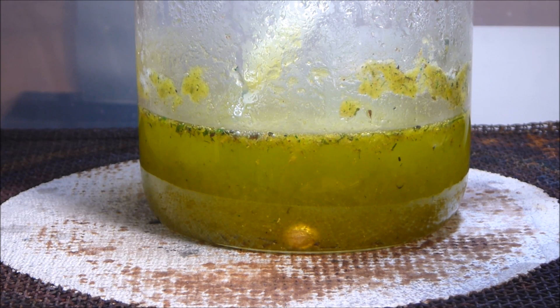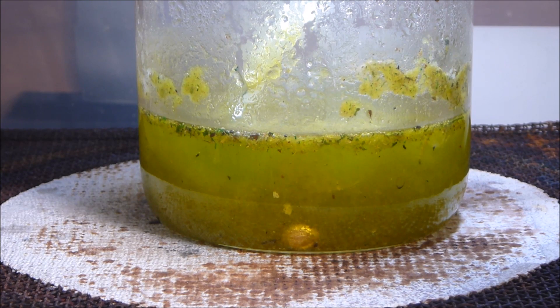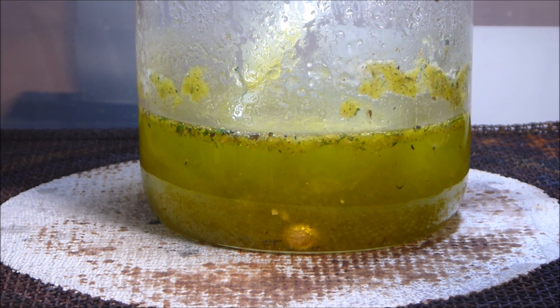If there's no reaction with that gold button at that point, I will cool the solution with ice — put three or four ice blocks in — then filter it all out, which should give me a nice clear solution. All the contaminants you see in there are quite large so it should filter out fairly easily, and then drop the gold out in the normal way. That's how you do sulfamic acid de-noxing — it works very well, but you need to have that gold button in there to have control over what's happening so it's very visible when you know what level you're at and when you're done, because you don't want to overdose on the sulfamic acid.